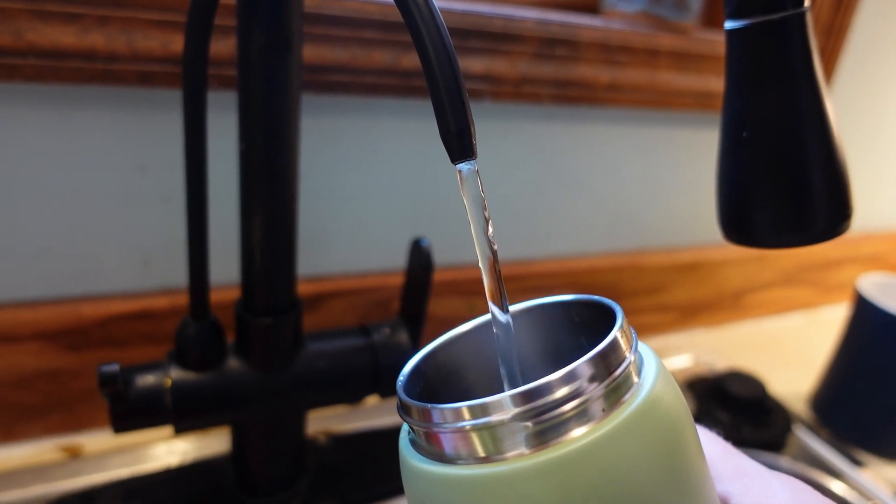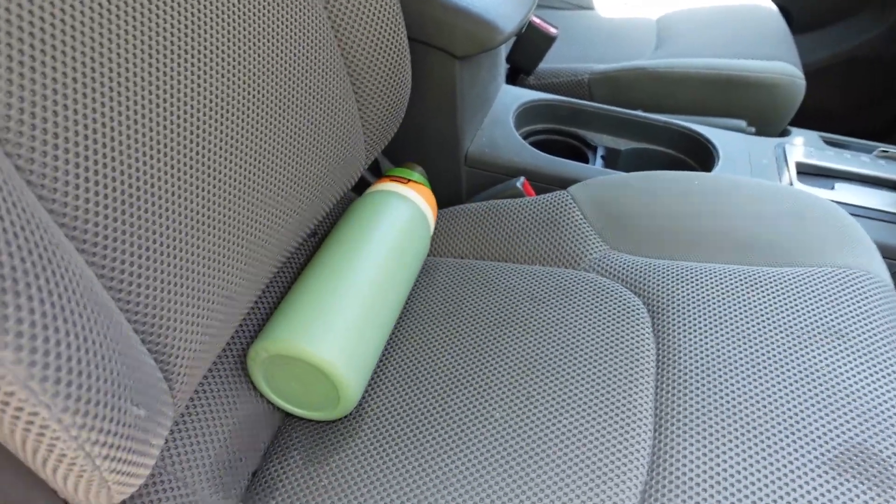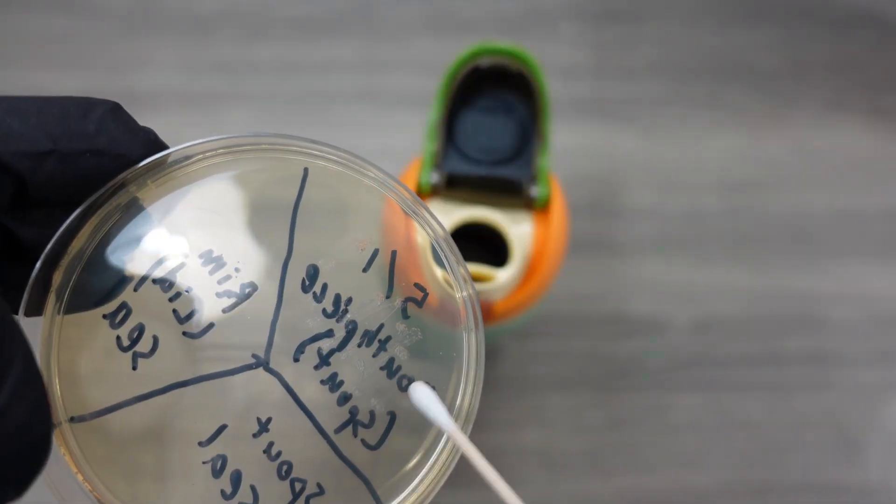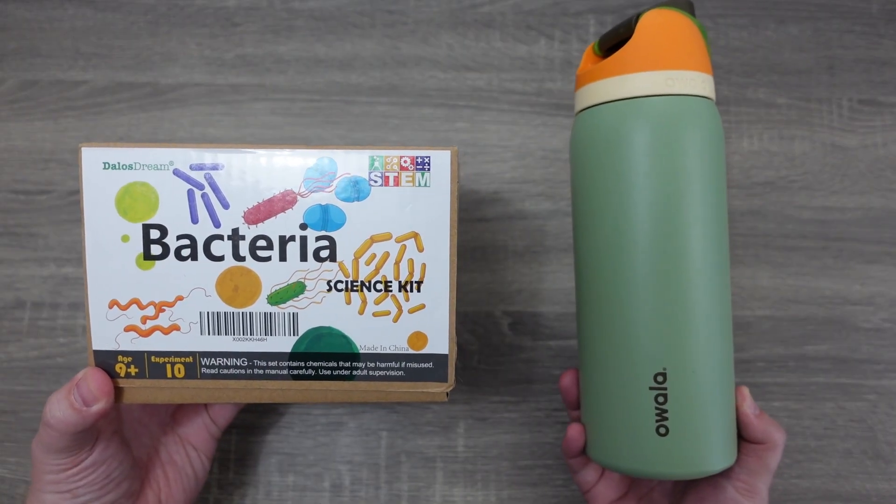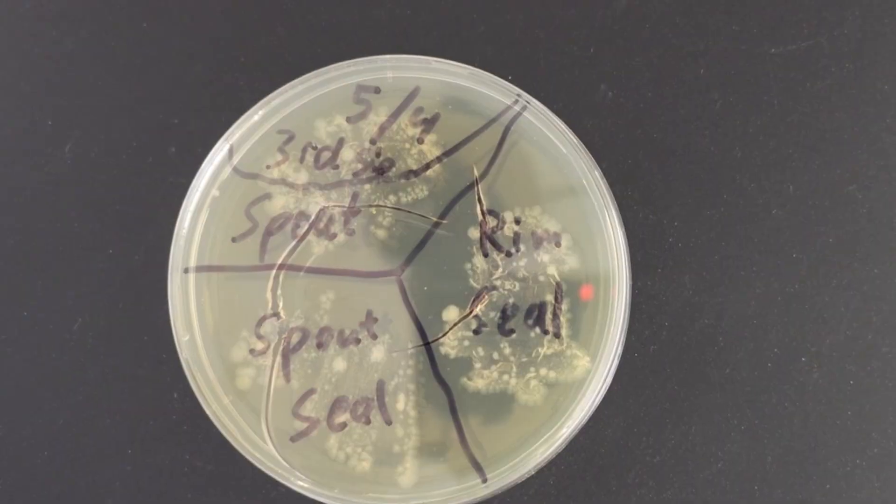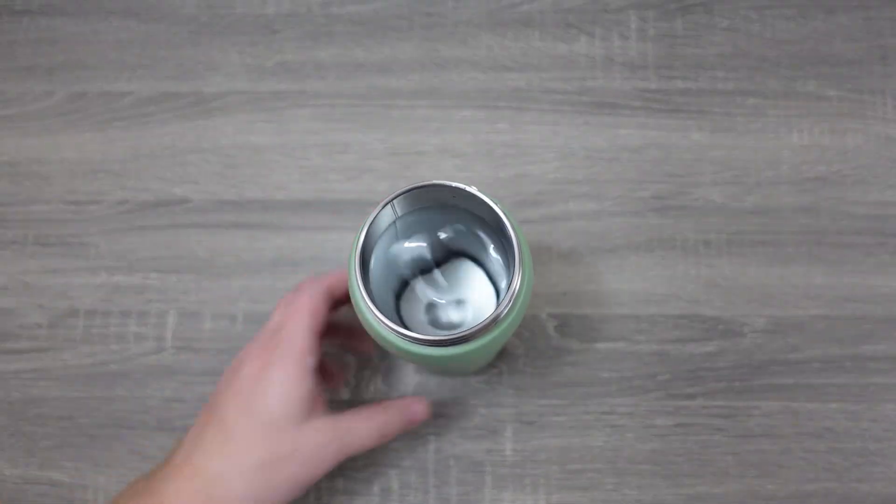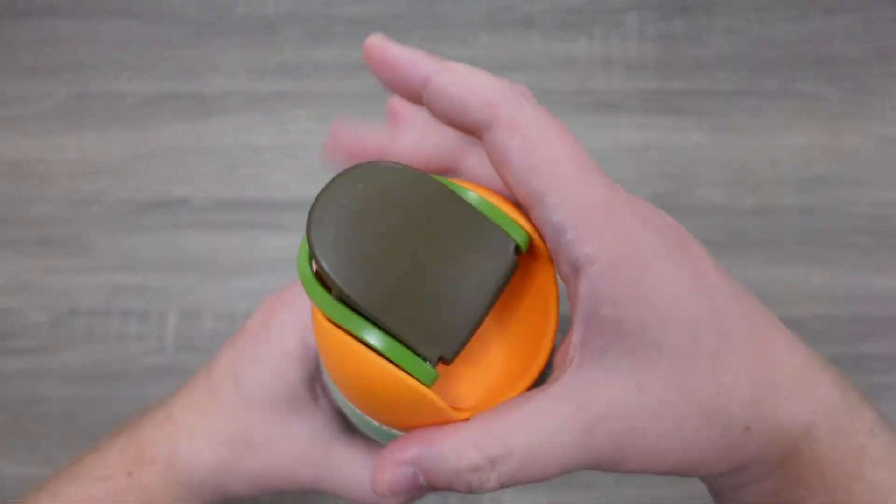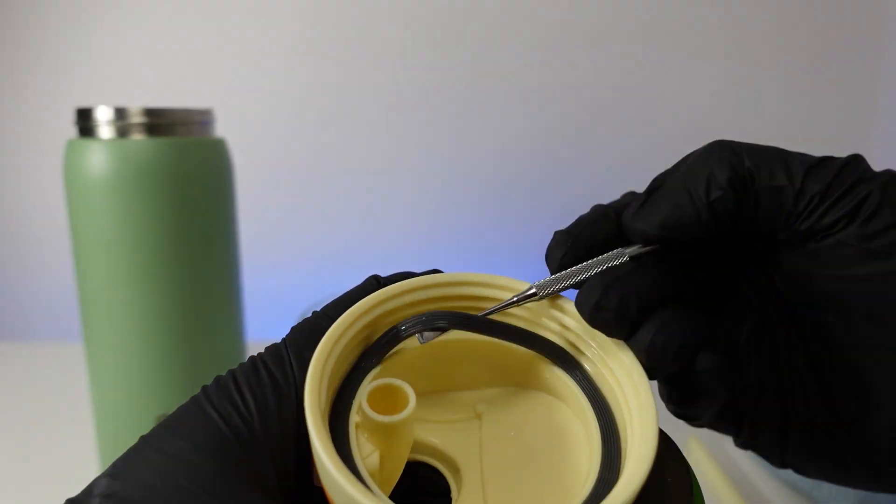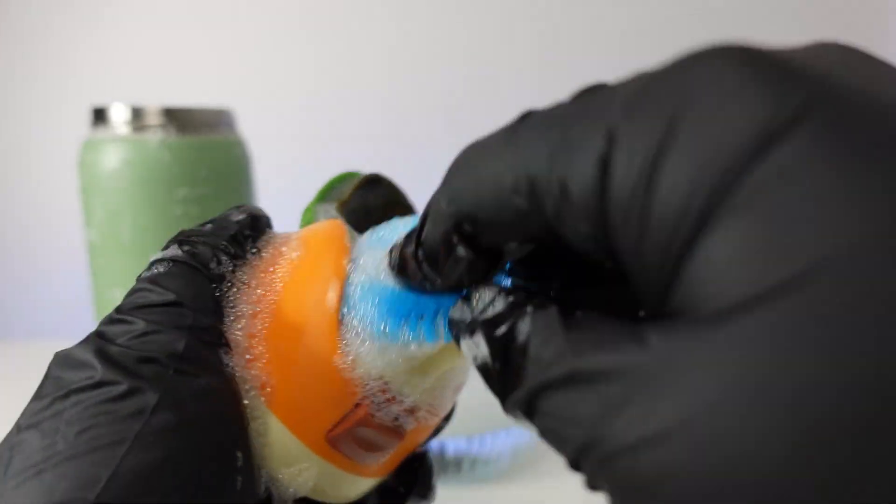I filled up a stainless steel bottle with water, left it in my car for a week, and did a series of bacteria tests using this kit off Amazon. Let's just say the results were kind of revolting. So if you or someone you know have struggled to clean your bottle regularly, hopefully this video will be the motivation you need to pick up this healthy habit.